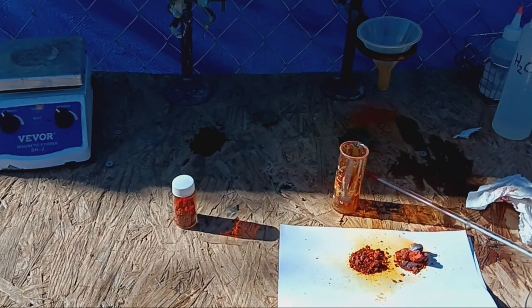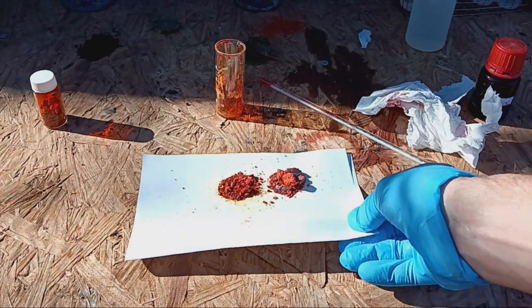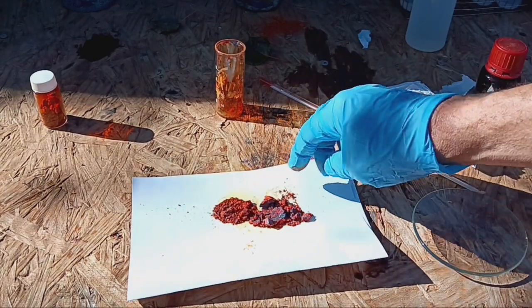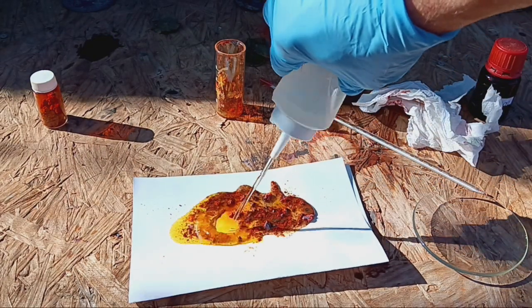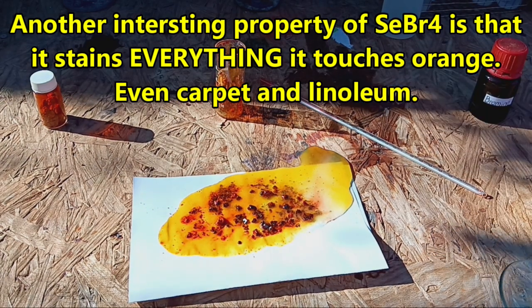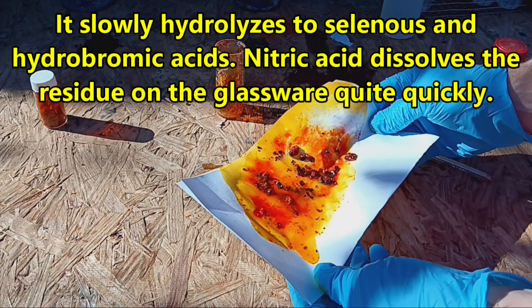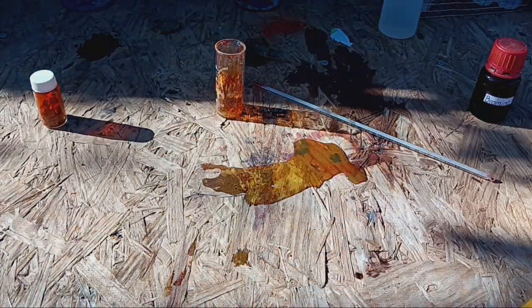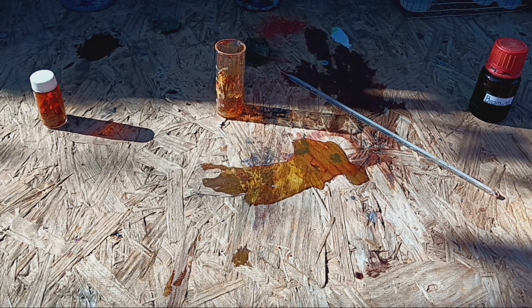There's the stuff with the unreacted selenium - every time there was some, the stuff at the very bottom would always have unreacted selenium in it. Oh, you want to see what happens when you put water on it? Nothing, it just goes away. No violent reaction - no such luck. It turns paper to mush in pretty short order - it's like liquefying it.